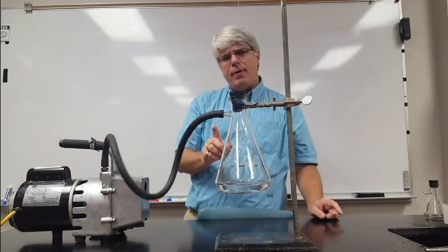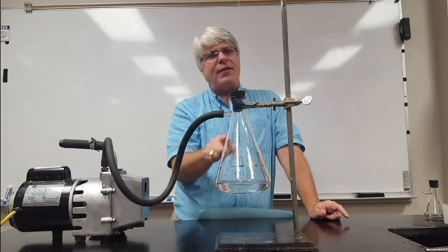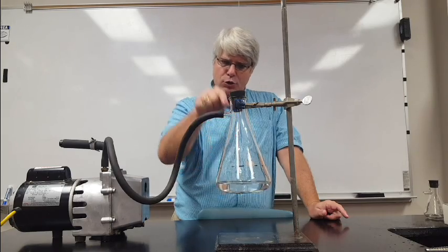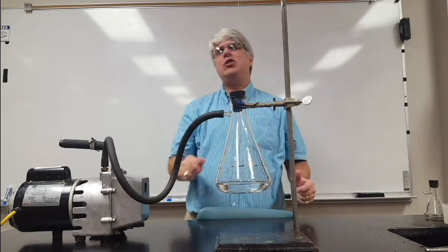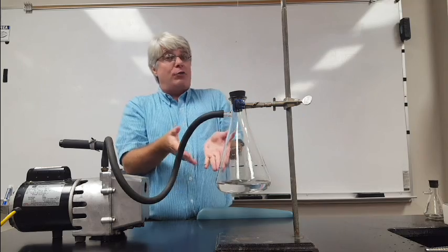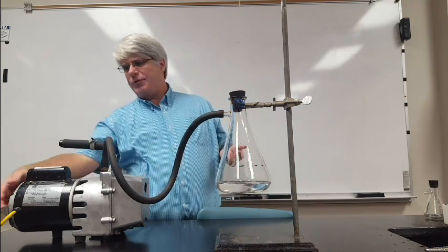Now when I turn the vacuum pump on, it's going to pump air out of the flask. So the pressure to which the cyclohexane is exposed is going to go down dramatically. So let's do that. We'll turn on the vacuum pump.